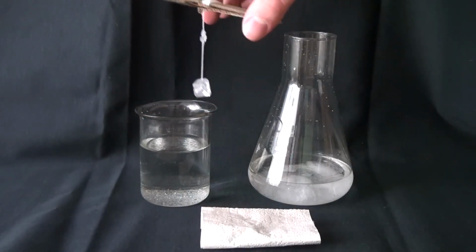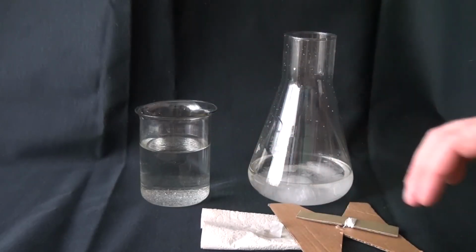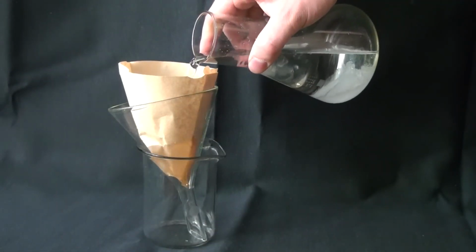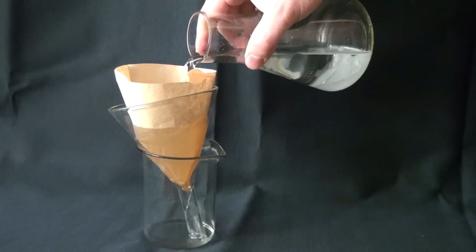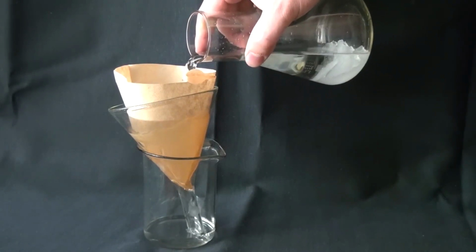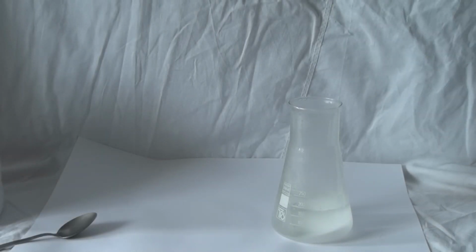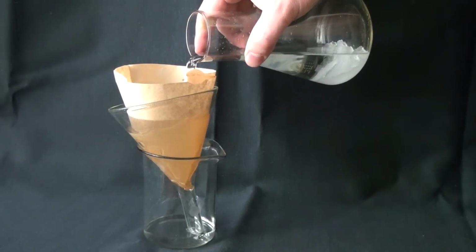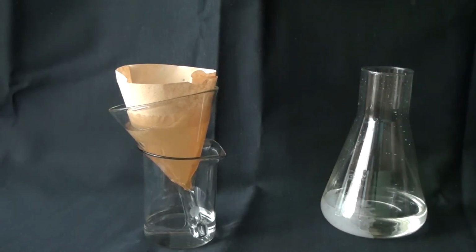But that's also a problem. During the evaporation of liquid, it comes to a certain time when there won't be enough solution in the cup anymore, and the further growth of the crystal will be impossible. To solve this, once a month or once every 2 weeks, it is necessary to add a saturated solution into the beaker. The saturated solution must be prepared the same way as it was before. However, you should not add a warm solution. The saturated solution should be the same temperature as the growing crystal.